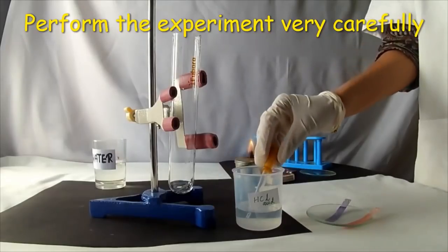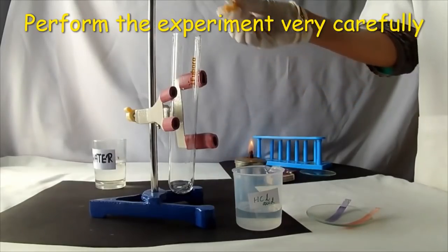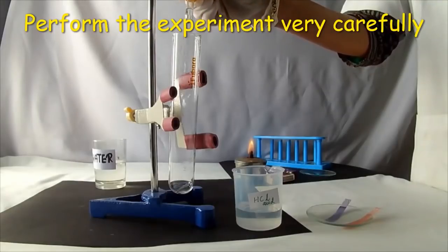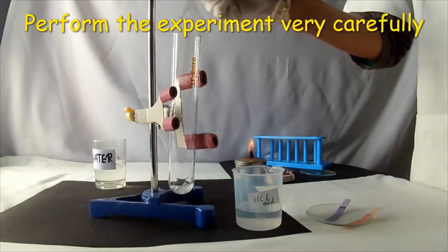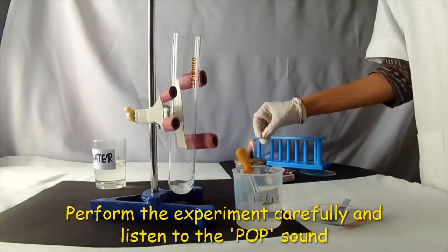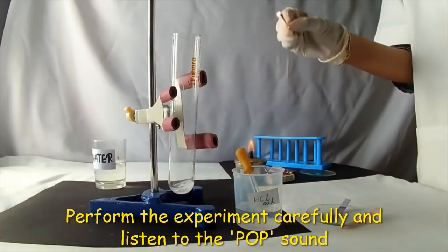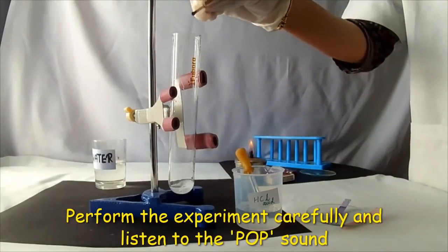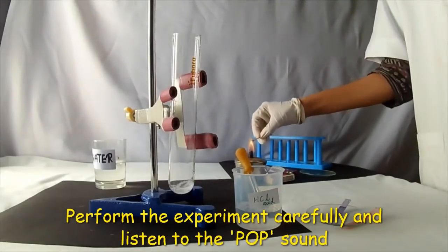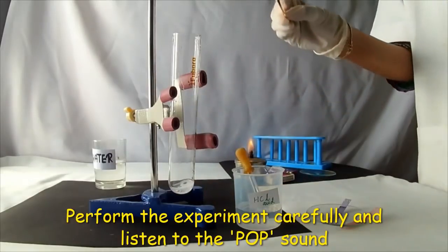Take the hydrochloric acid and add a few drops into the test tube and observe the evolution of hydrogen gas. Light the matchstick and introduce it into the test tube. Listen to the pop sound.